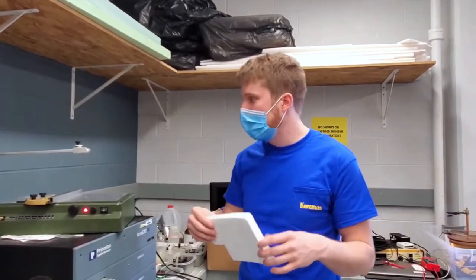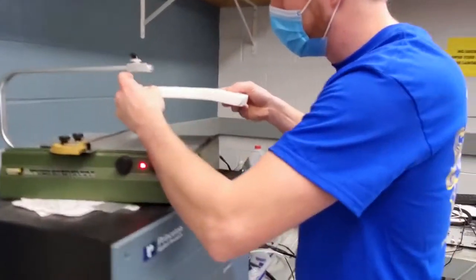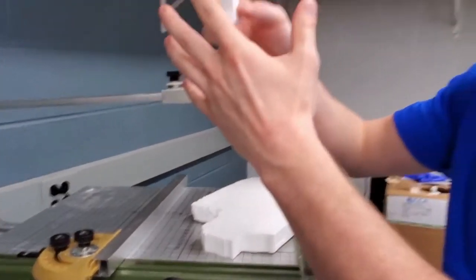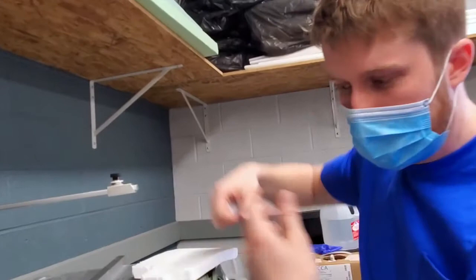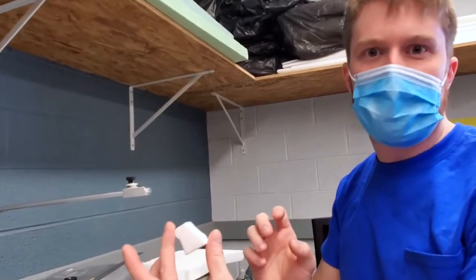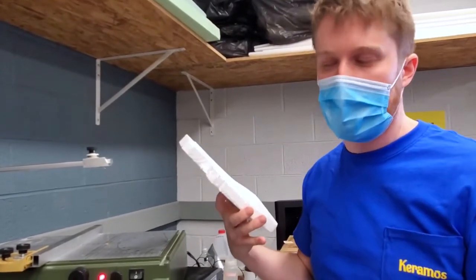So one way we use that is we take this foam cutter, and you can cut off whatever shape of foam you want, and then you glue those pieces of foam together to build your shape. You pour in your plaster mold around that, which hardens, and then you burn out the foam that's on the inside, which then allows you to pour metal into that cavity and get the desired shape.